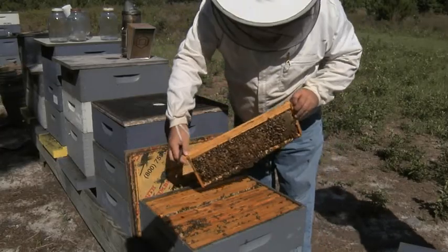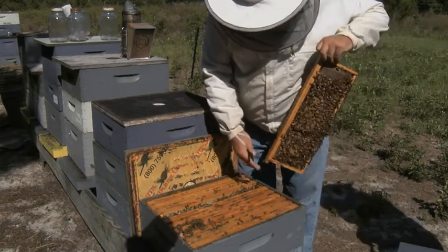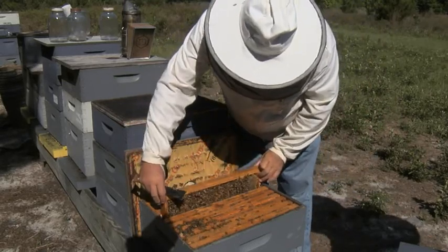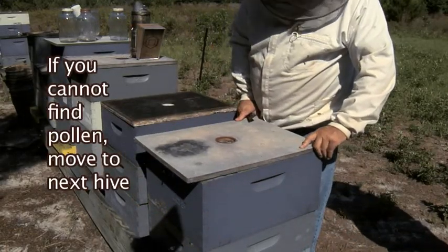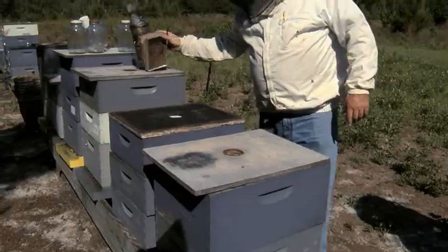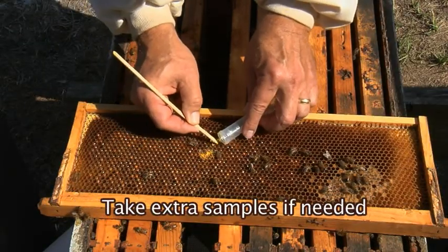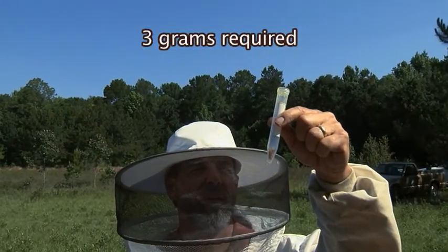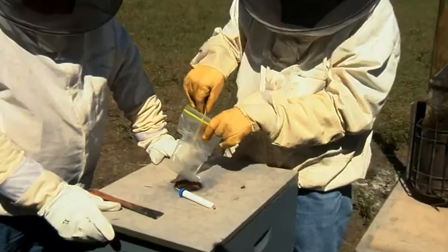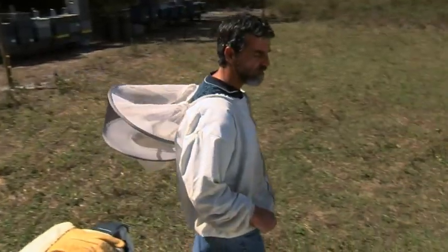If the frame you removed for sampling does not have pollen in it, set it aside and try to find another frame with pollen in the hive. If you cannot find any pollen in the hive, move to the next hive for sampling. If you cannot gather pollen from a particular hive, take extra samples from the remaining hives to collect the required total of 3 grams. Dispose of the sampling sticks in the trash. They should not be used again.